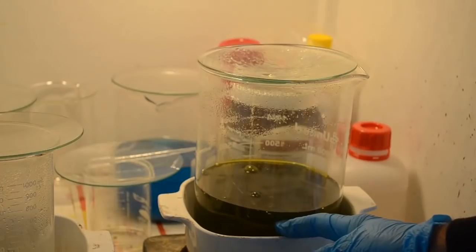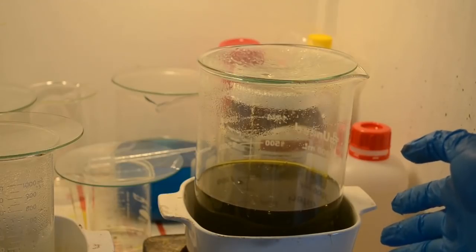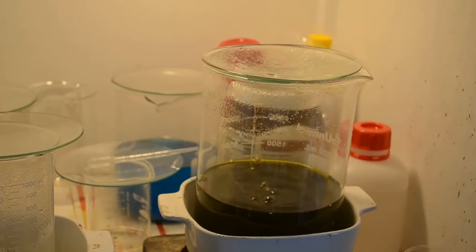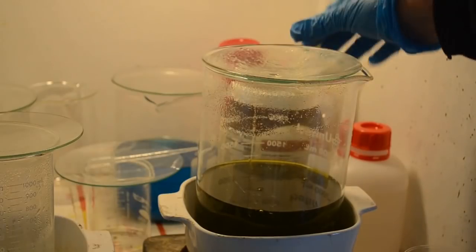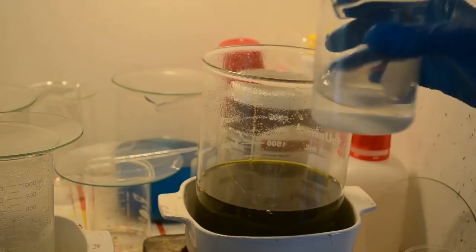Now, speaking of the liquid over here, it's heated up. All the activity I see is just boiling. I don't see any kind of actual reaction to the nitric acid I put in there. I'm going to turn the heat off so it can start cooling down. So, yeah, it's just boiling. In fact, it's thumping a little bit, which I don't like because I don't want to break my big 3-liter beaker. But no reaction, no fumes. So, I think it's done. Let me see about denoxing it. I've got my usual solution of sulfamic acid here.